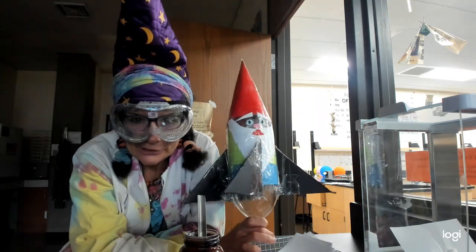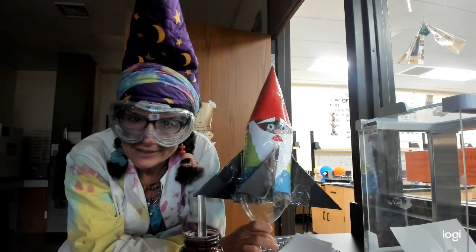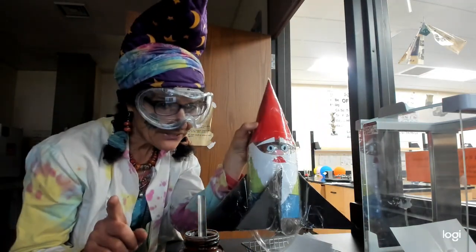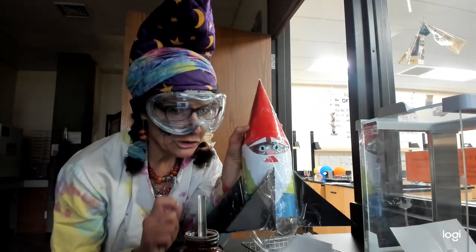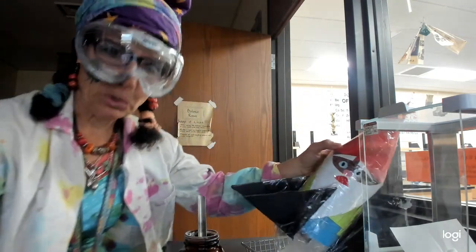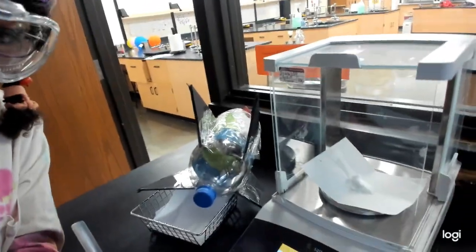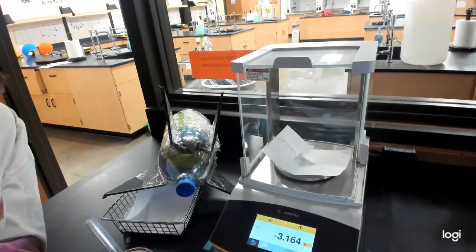And this little gnome, who's a rocket ship on his off time, he and I measured out the salicylic acid. Remember the scales? And scales are very touchy because they're very lonely. So we measured out 3.164 grams. If you don't believe us, we'll see if we can do it right this time. Can you see? Maybe? Maybe not. There we go. 3.164 grams. All right, I'll write it down. And we're going to pause.